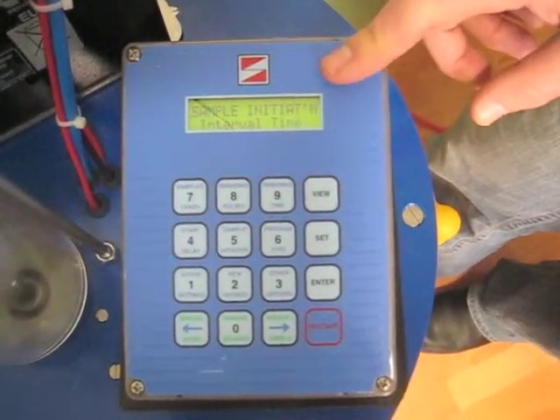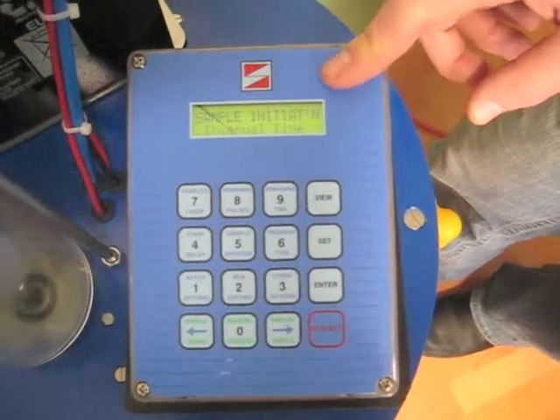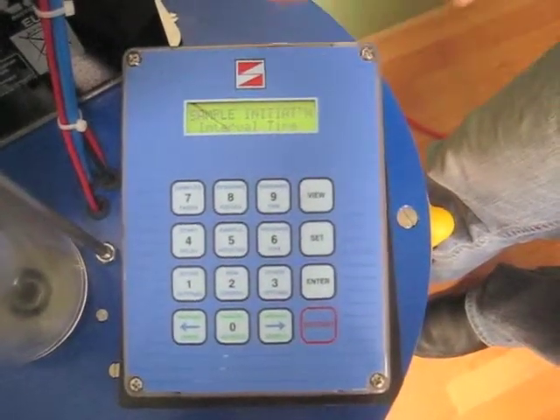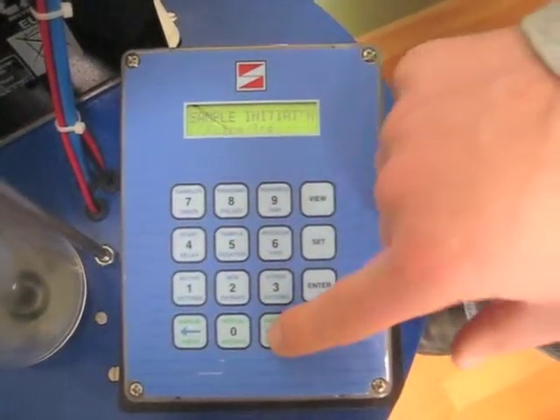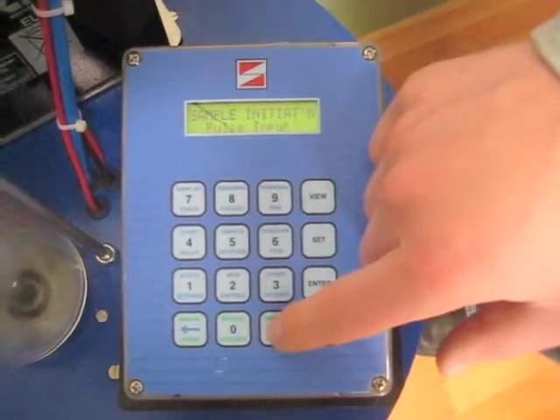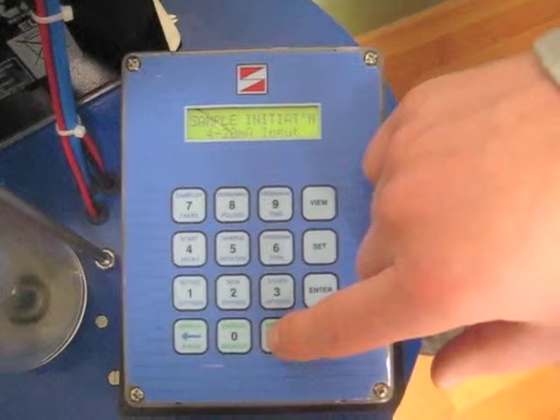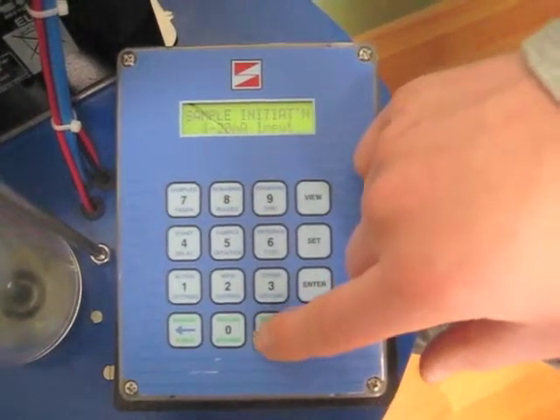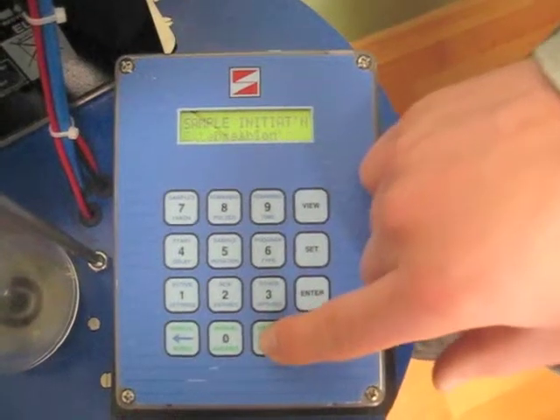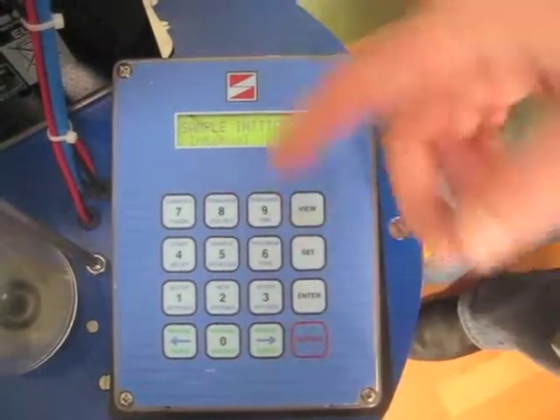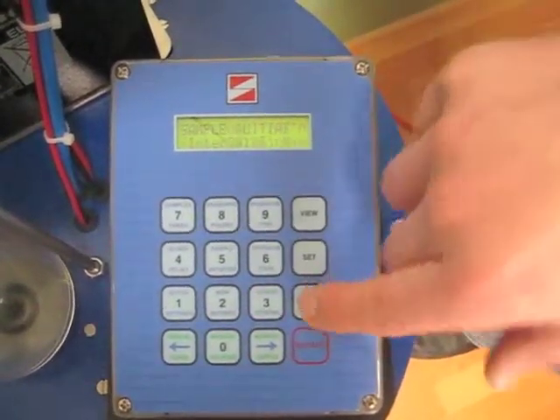Sample initiation. After you've started the sampling, now how would you like to continue sampling? This is set currently to interval time. Other options would be to continue using pulse or a 4 to 20 milliamp input if you're doing flow based sampling. External contact, again, say you've got an external PLC that's doing everything. You can disable it or leave it on interval time, which is what I'll do now.